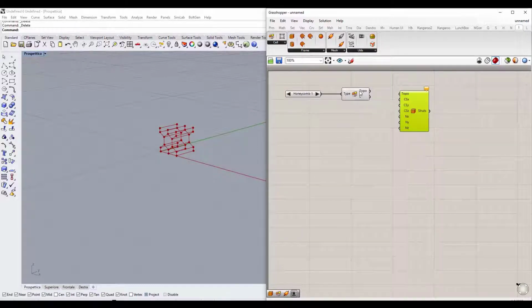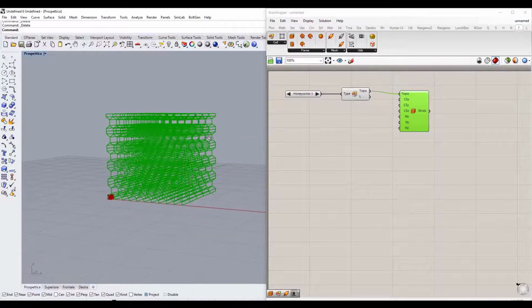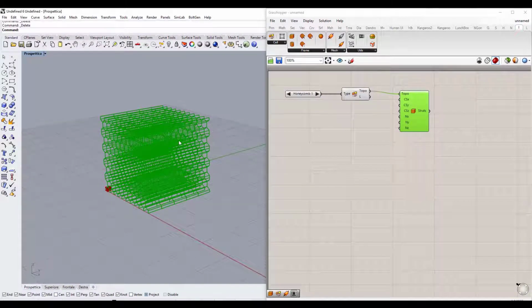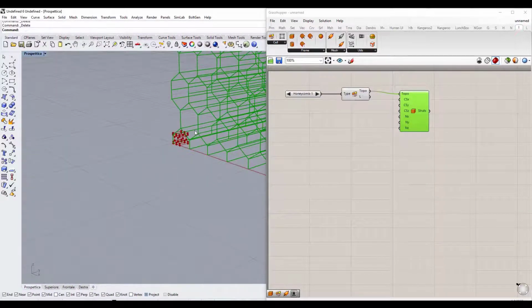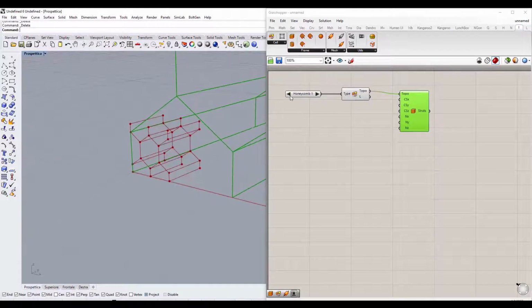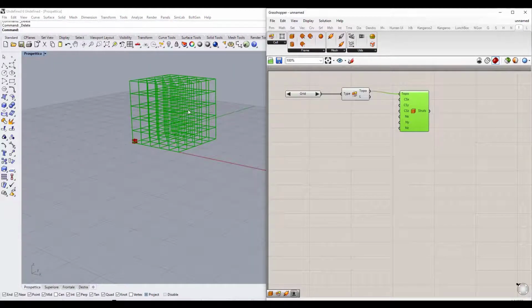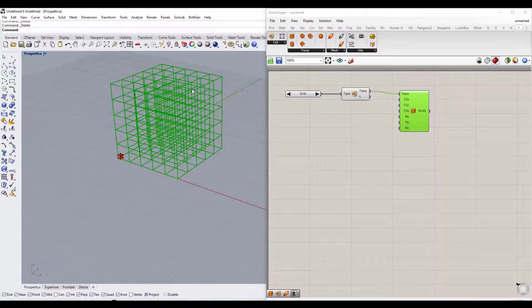Grasshopper works through connections between the various components. Let's connect the two together, simply by dragging. Okay, you can see in the 3D window the entire cubic structure of our scaffold with a basic elementary cell composed of cell type one. We can go back to grid cell type.